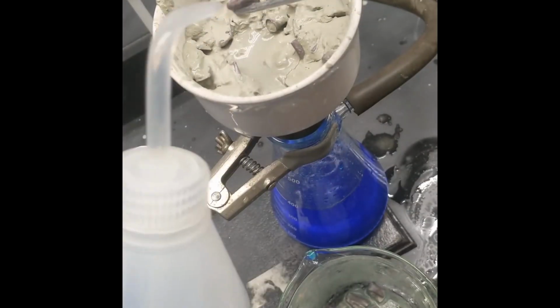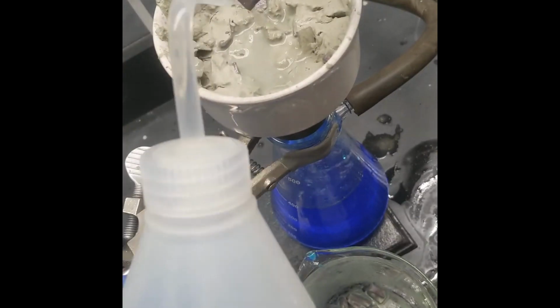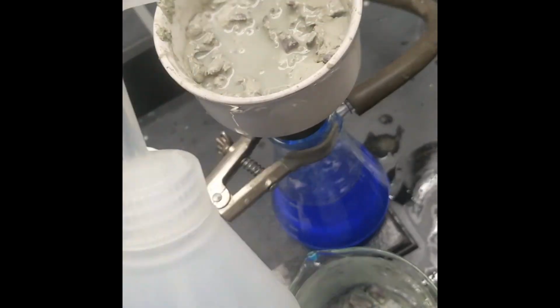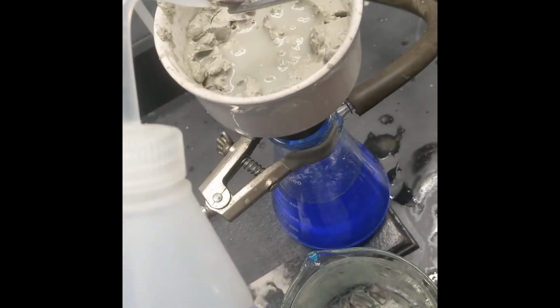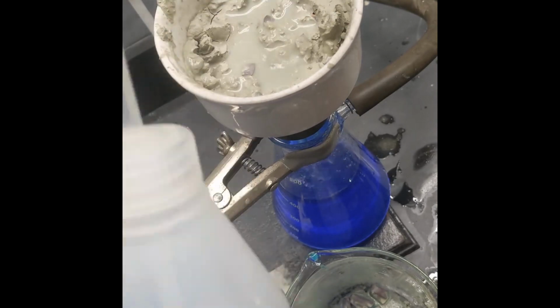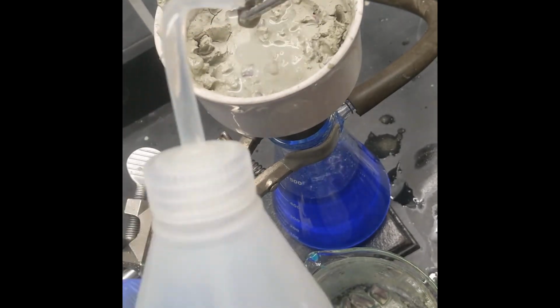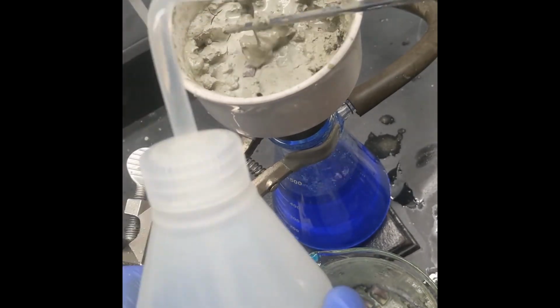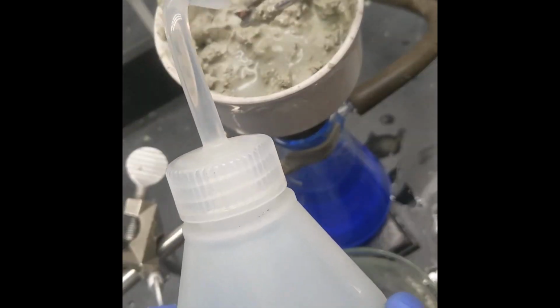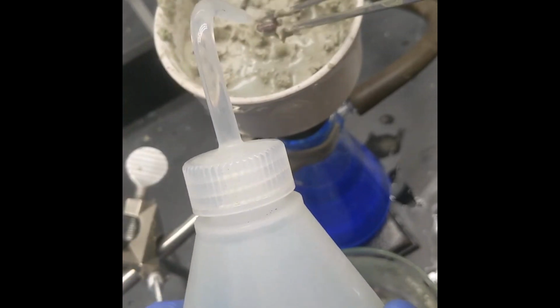Remember all those bits of copper I used to precipitate the silver? They didn't just go away, and it was not really quite clear how to get the silver off other than picking them out and washing them. And I'll tell you, it was about as much fun as it sounds. I do think it's pretty neat though that even though the original solution looks absolutely terrible, after you filter it off, the copper nitrate looks as blue and perfect as ever.